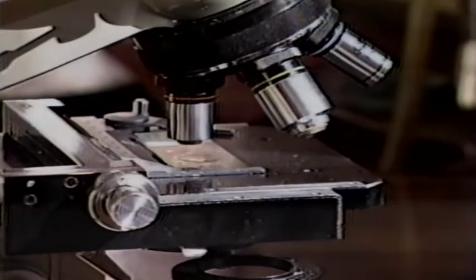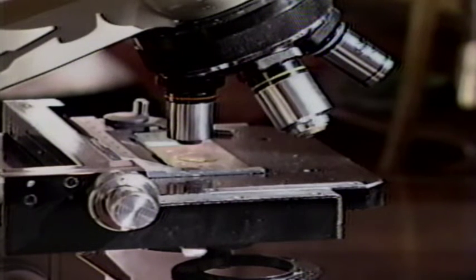After achieving the best possible illumination of the specimen, an objective lens can be chosen. The actual selection of the objective lens depends on the characteristics of the specimen and what you wish to see. For example, if you wish to see the overall pattern of the veins of a leaf, the low-power objective would be most appropriate. But if you want to see the leaf's individual cells, a higher magnification would be called for.